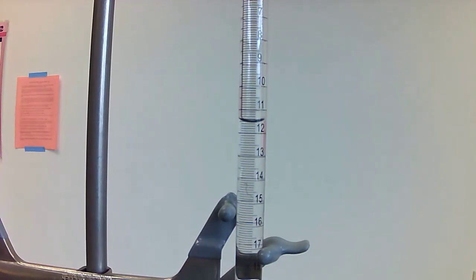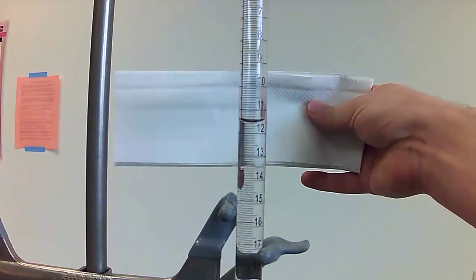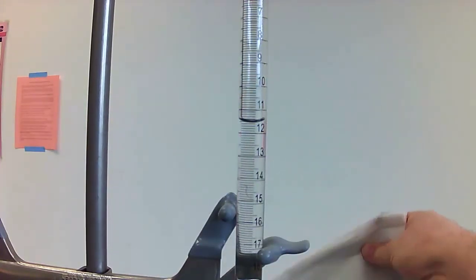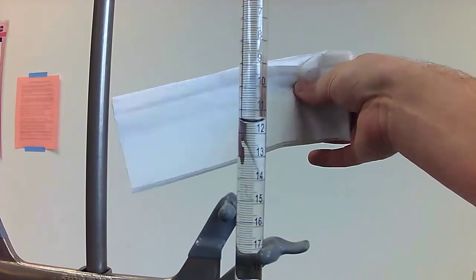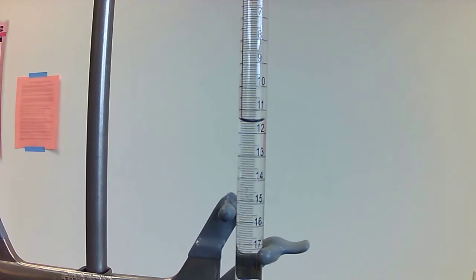Now it looks black at the moment because of how the shadows are playing on it. If I were to take a white piece of paper or a paper towel, which I have handy, and put it behind it, you can change how it appears, whether it has a shadow or whether it doesn't. And it doesn't matter what you do as long as you're consistent. So record your initial measurement.